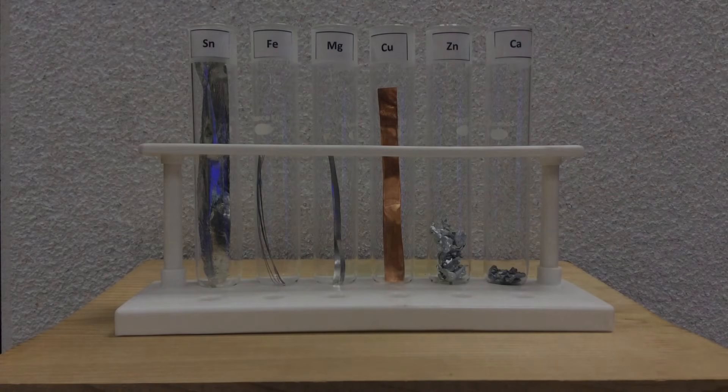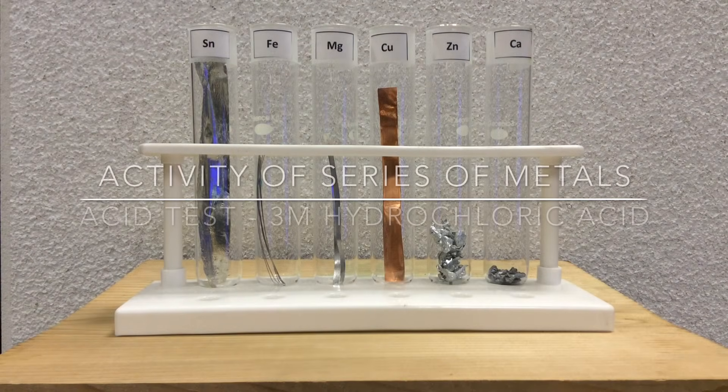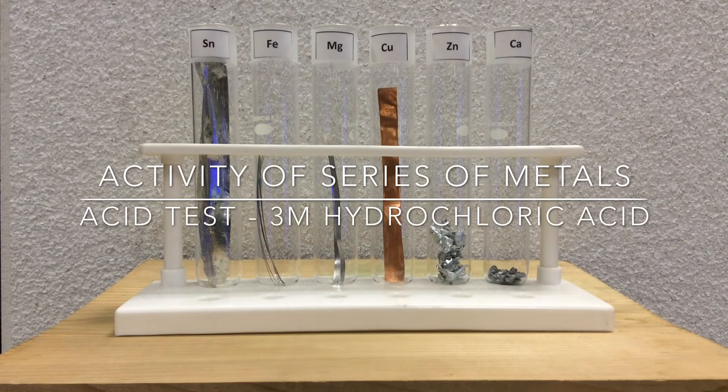So this is the very classic activity series lab where we're going to test six metals with acid and water.